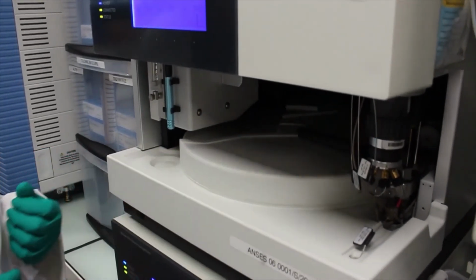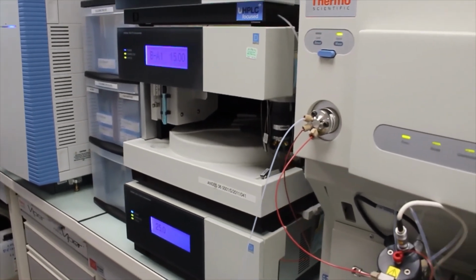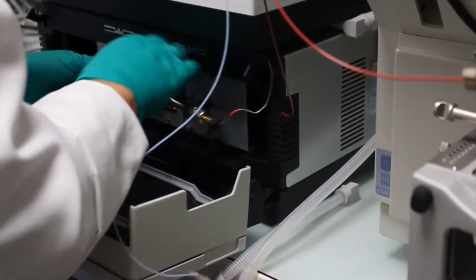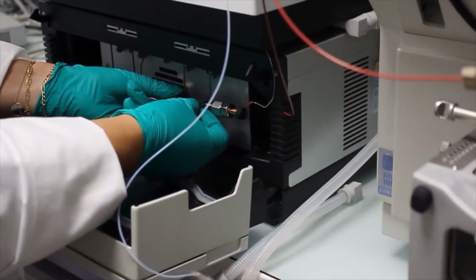The different standards prepared in sugar solution used for the calibration curves, and the samples of nectar are placed into LC and GC autosamplers.